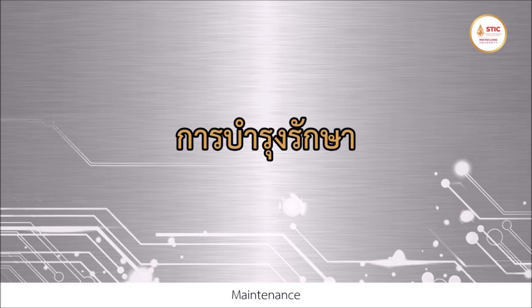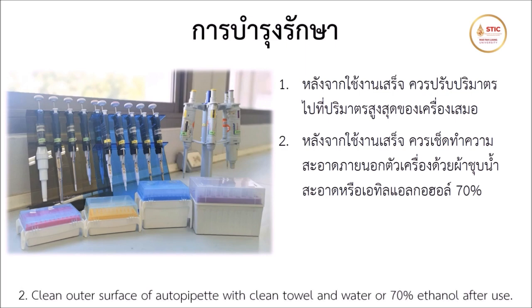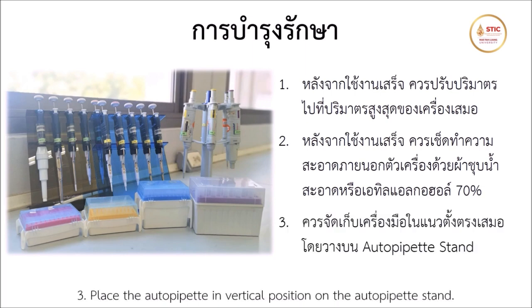Maintenance. Always adjust the volume to maximum after finished. Clean outer surface of autopipette with clean towel and water or 70% ethanol after use. Place the autopipette in vertical position on the autopipette stand.